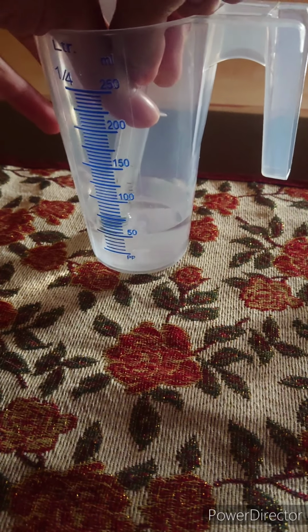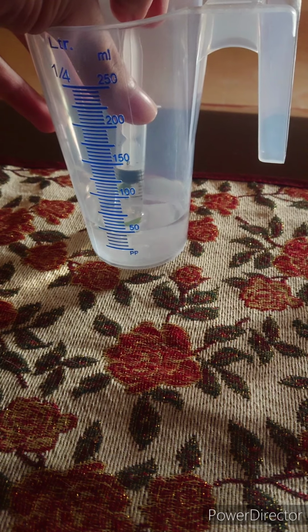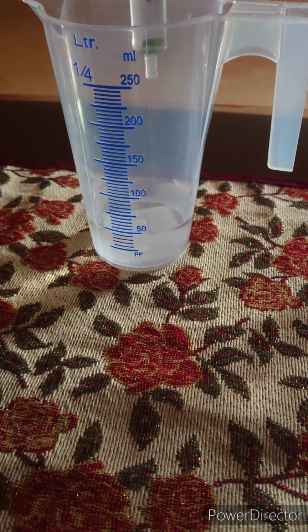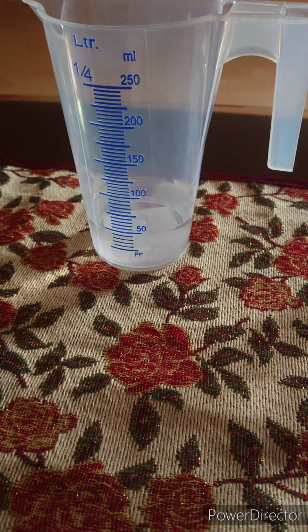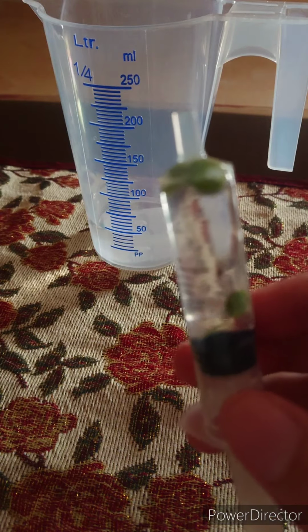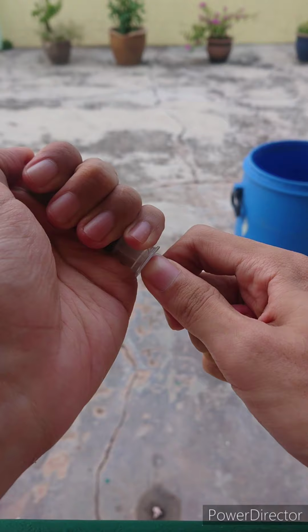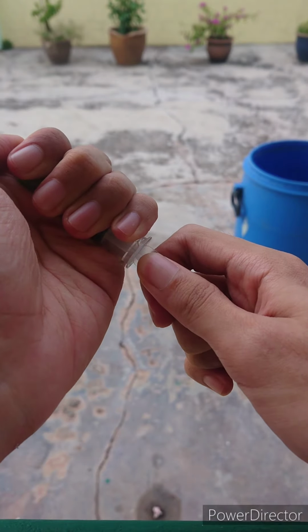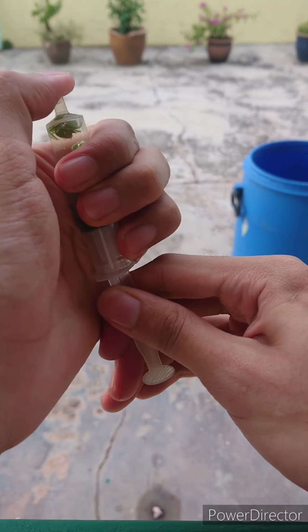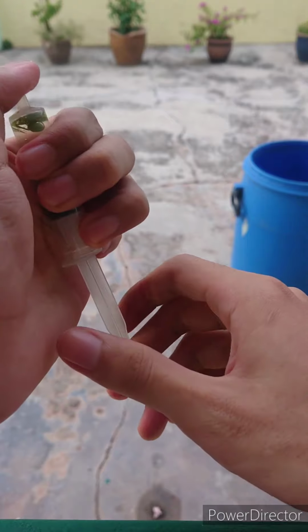After I put the leaf discs into the barrel of the syringe and tap them down to the tip, I draw around 6 ml of bicarbonate solution into the syringe. The leaf discs still float in the solution, like in this video. After I expel all the air by gently pushing on the plunger, I plug the tip of the syringe tightly with my finger and gently pull on the plunger to create a slight vacuum.